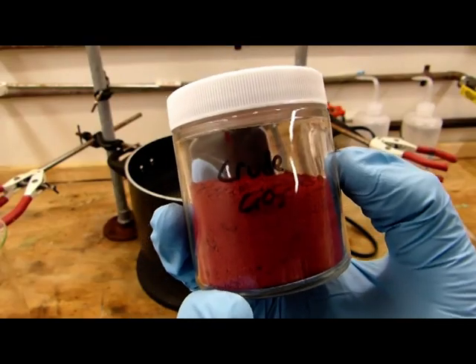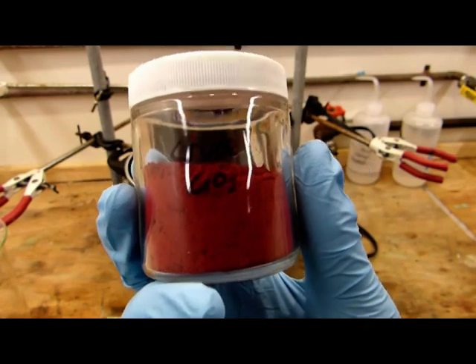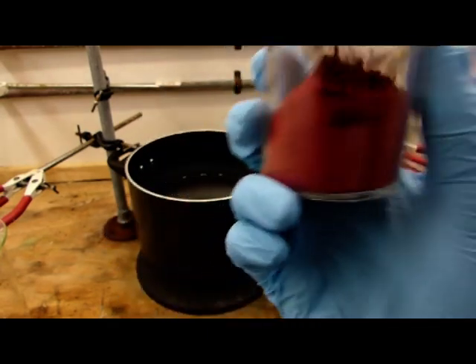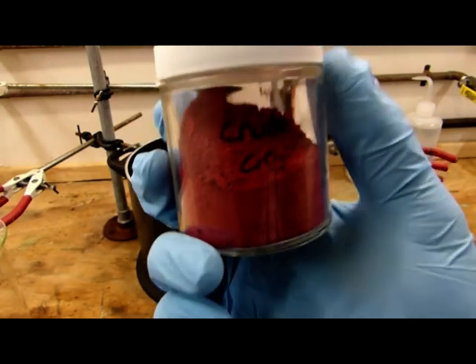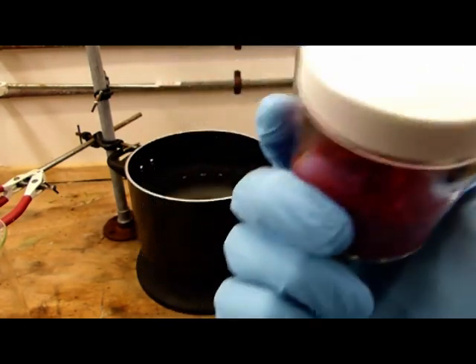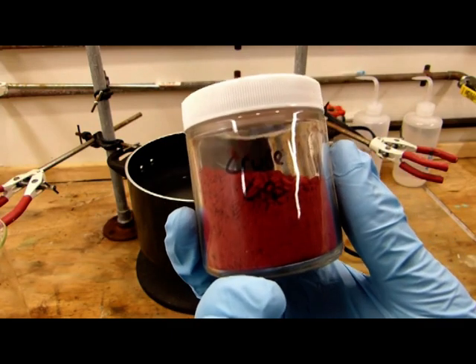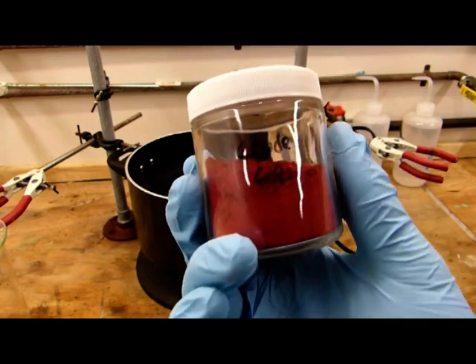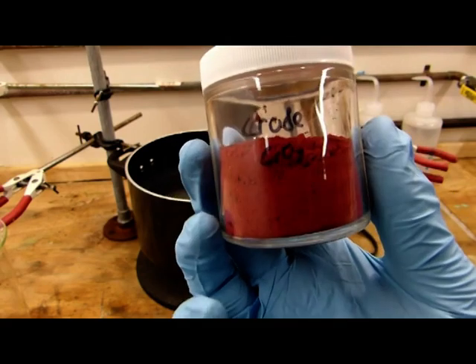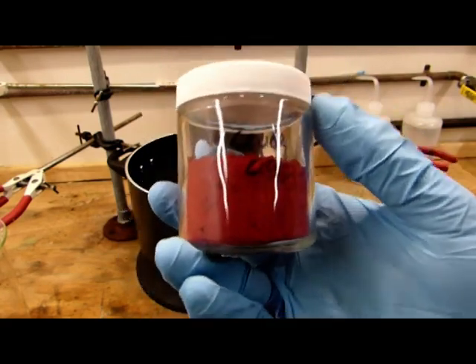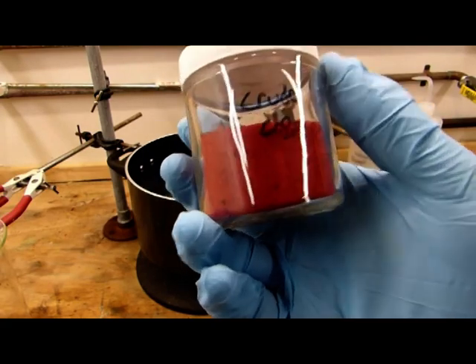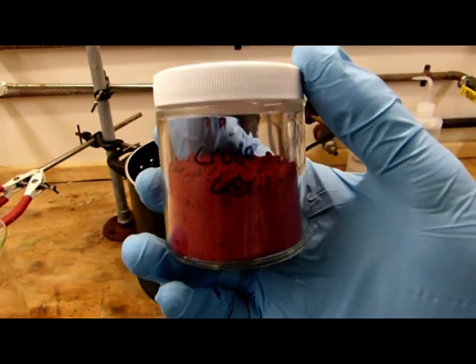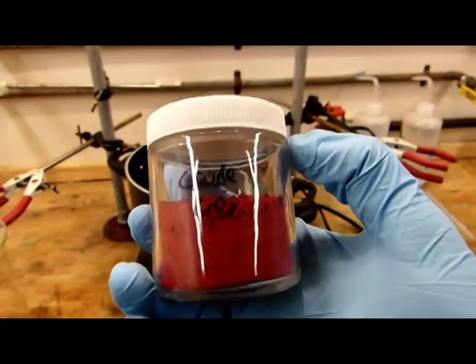Here is the final product. It is 71 grams of crude chromium trioxide, which represents a really really terrible yield. But considering my dichromate was of dubious origin online and also I've been using drain cleaner sulfuric acid, I think that's actually pretty good. More concentrated sulfuric acid of course would have produced more, but you run the risk of running into the bisulfate precipitation problem. So all things considered, I think this is not too bad. I actually have 500 grams of commercial chromium trioxide that I'll be using in some upcoming videos, which represents a much higher purity. But I thought I'd show how it's made just as a demonstration in case you're unable to get your hands on it or something. I'll do a final demonstration to show the strong oxidizing properties of chromium trioxide.